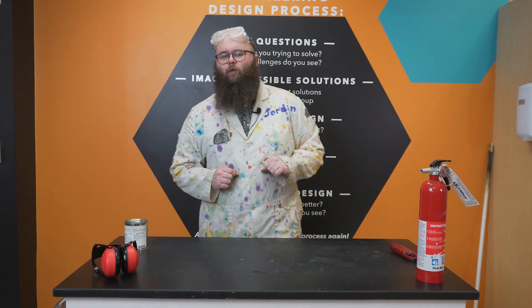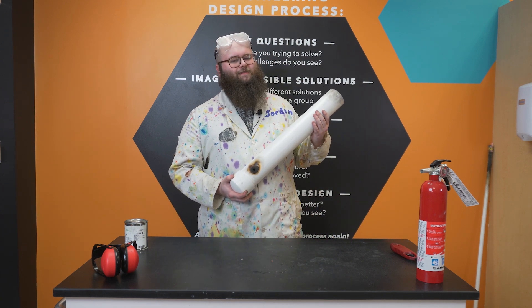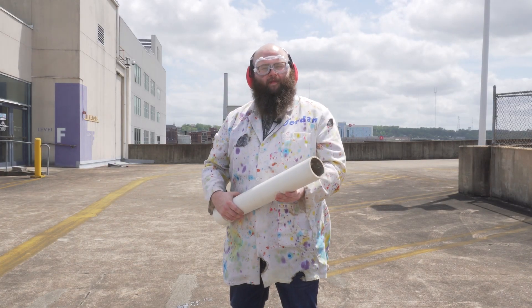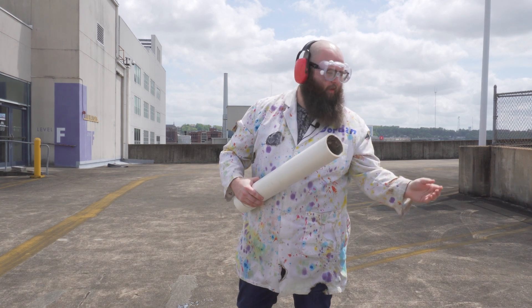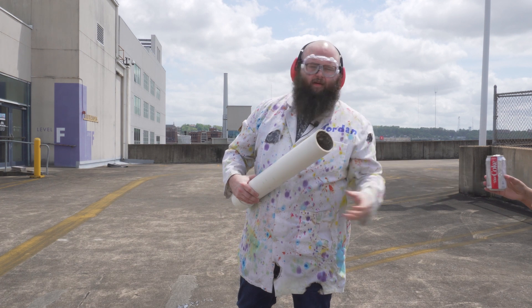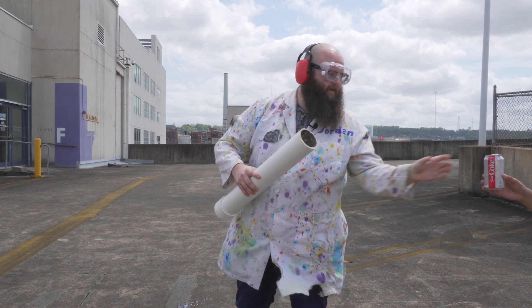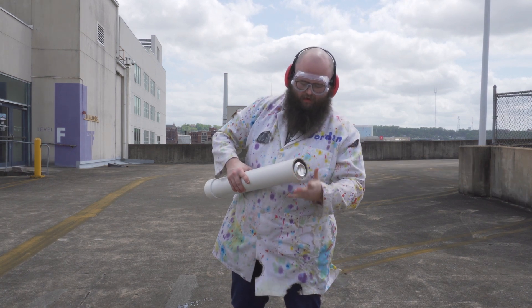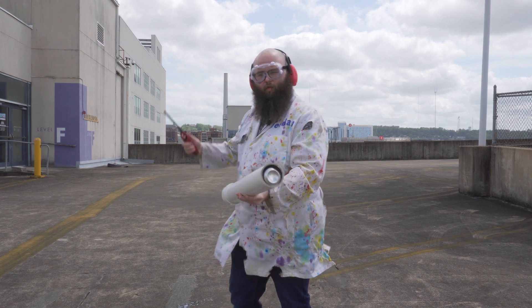Now, what if we were able to harvest that explosive force produced by the acetylene gas in an apparatus kind of like this? But first, I think we might need a little more space. Let's try it out. First, I'm going to add our calcium carbide, then the water, then a little oxygen, and finally a can. Now all that's left is to add a little heat. Let's end this episode with a bang.